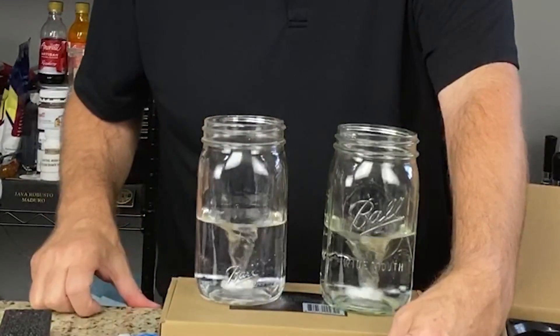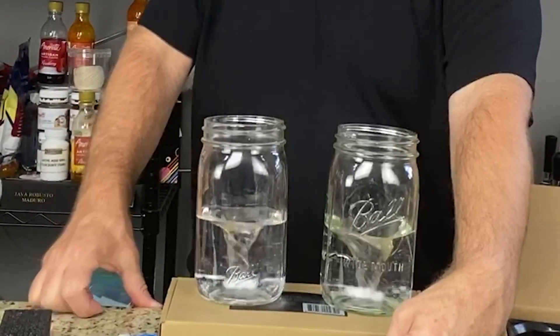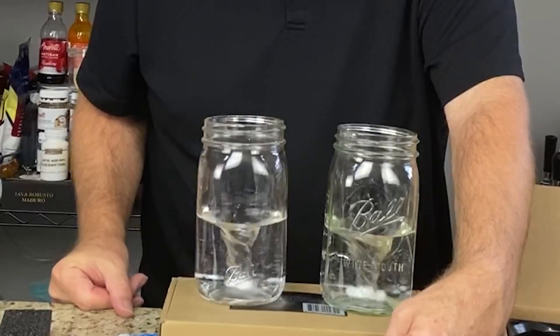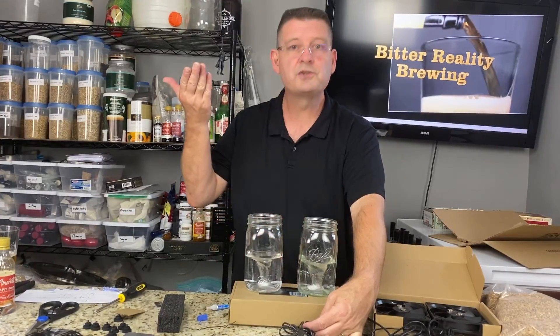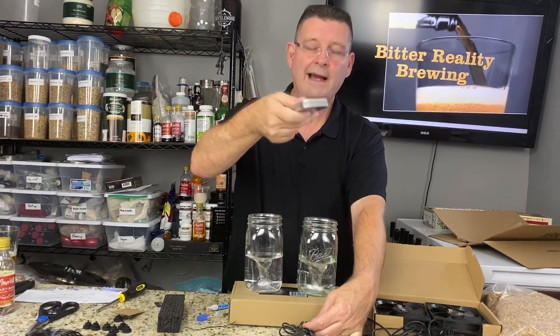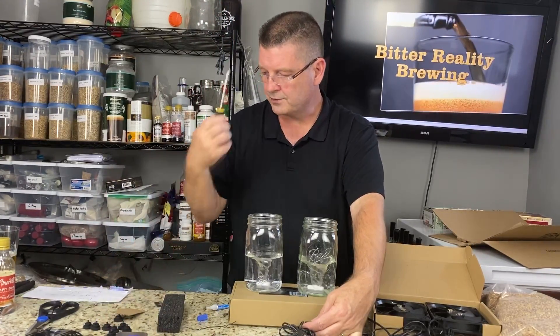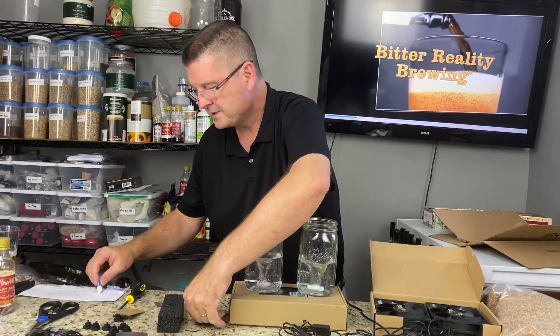We can go to high — high's doing pretty good right now. I don't always recommend high; sometimes it throws the stir bar off. But that's it. 20 bucks, two stir plates — that's 10 bucks a plate. Earth magnets if you don't have them, that's a few bucks. Screwdriver I hope you have, and super glue — a couple bucks at your local Walmart.